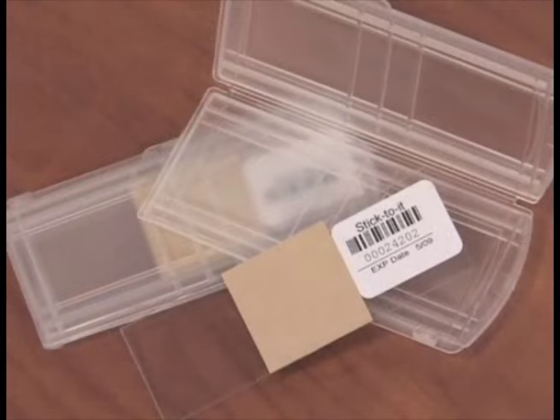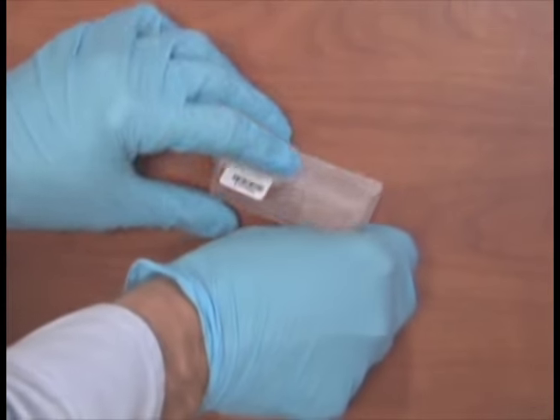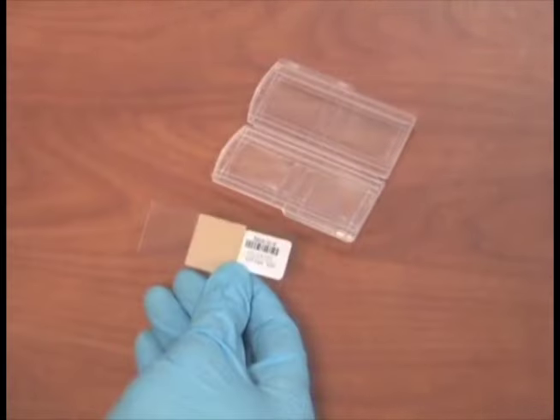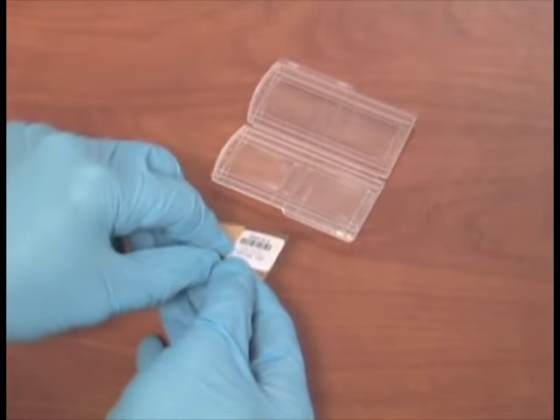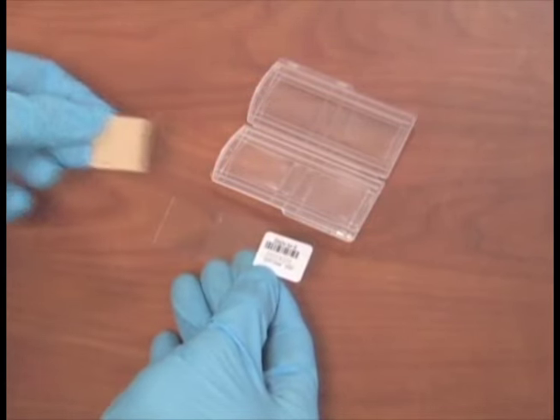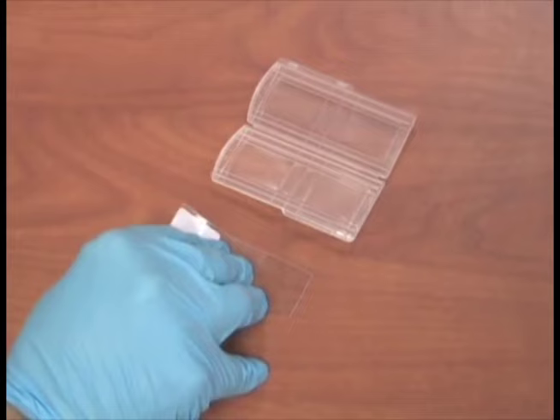Obtain a tape sample using biotape provided by Galson. 1. Open the plastic container. 2. Remove the slide. 3. Place the tape against the surface to be sampled.